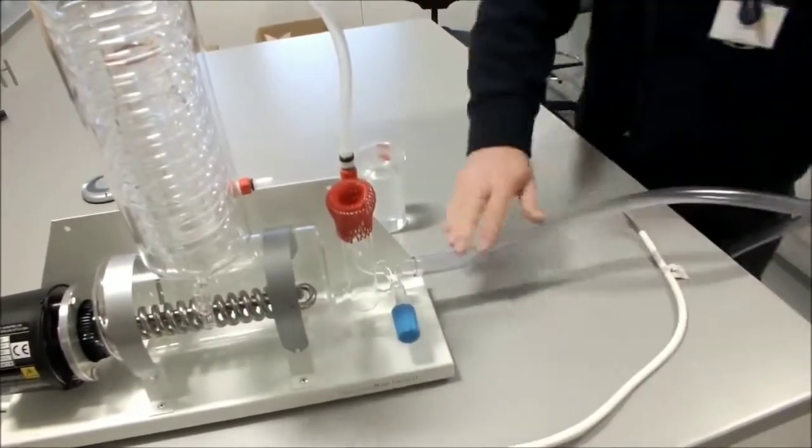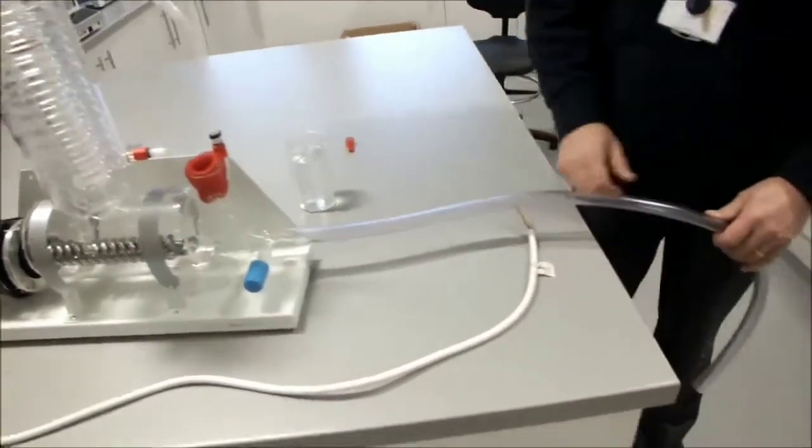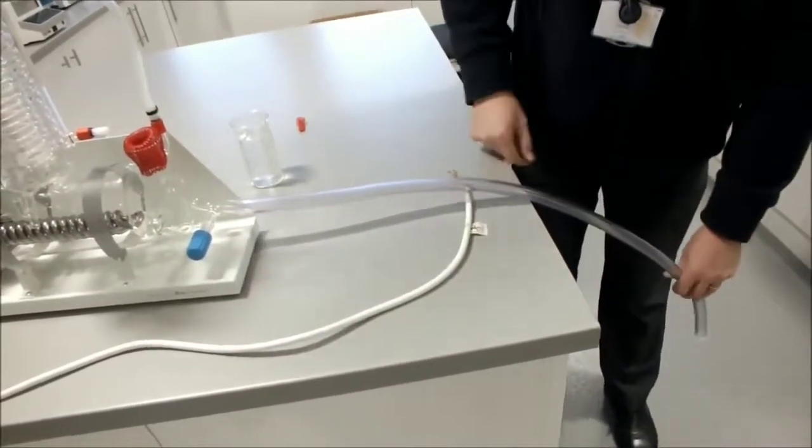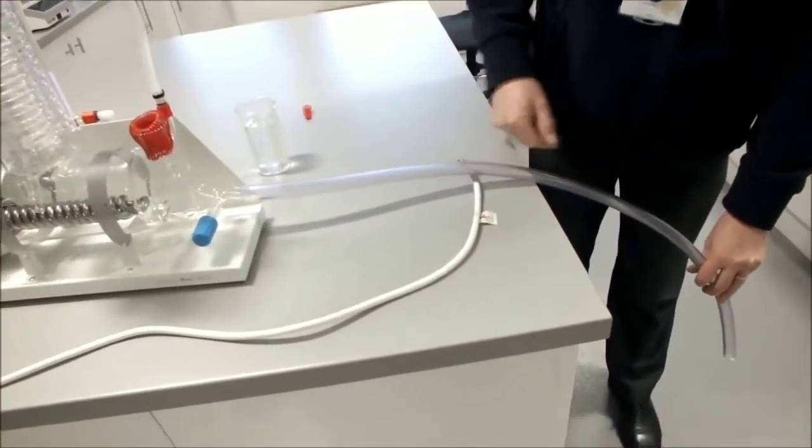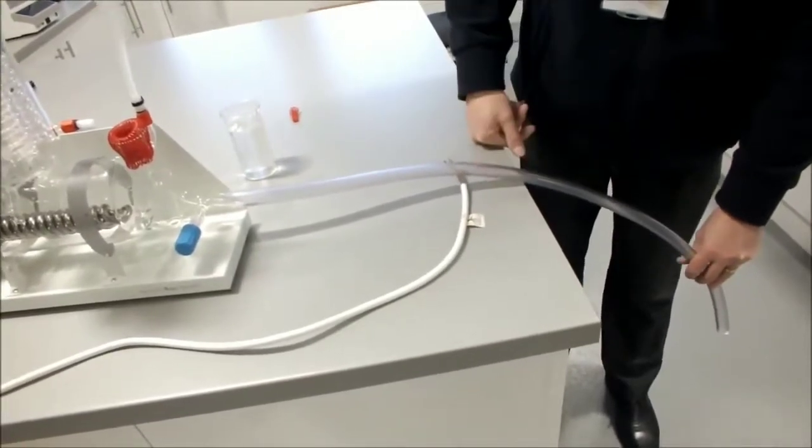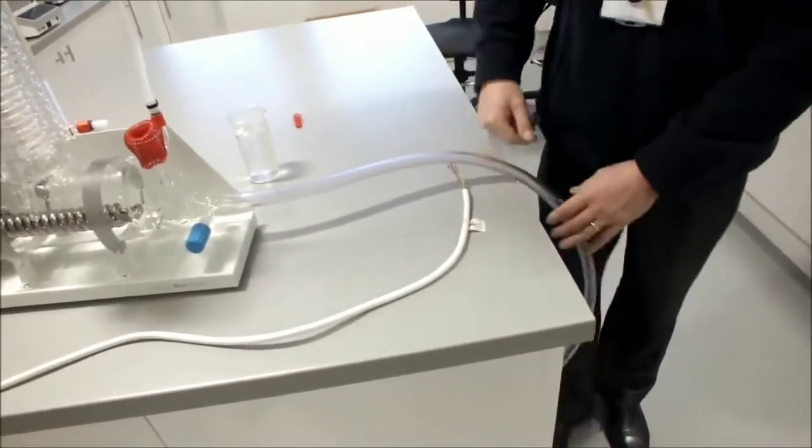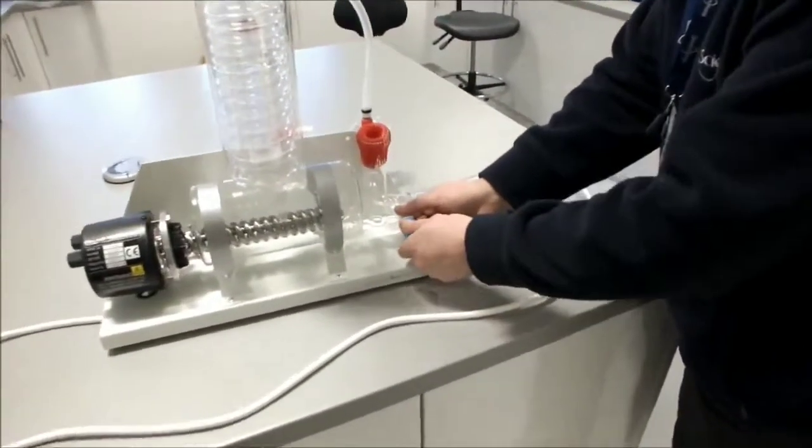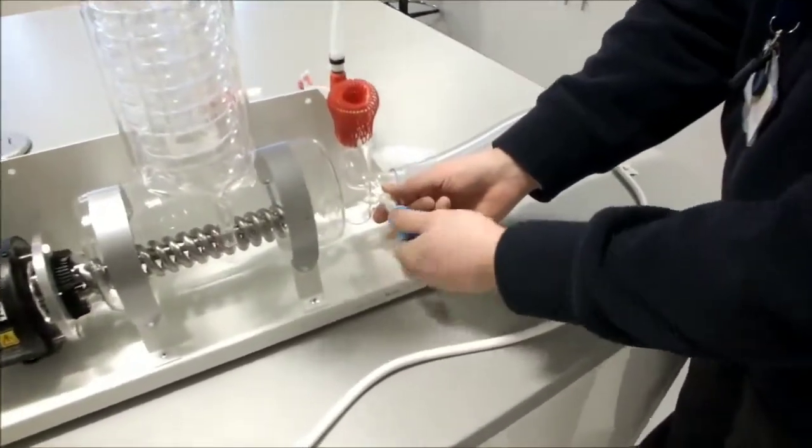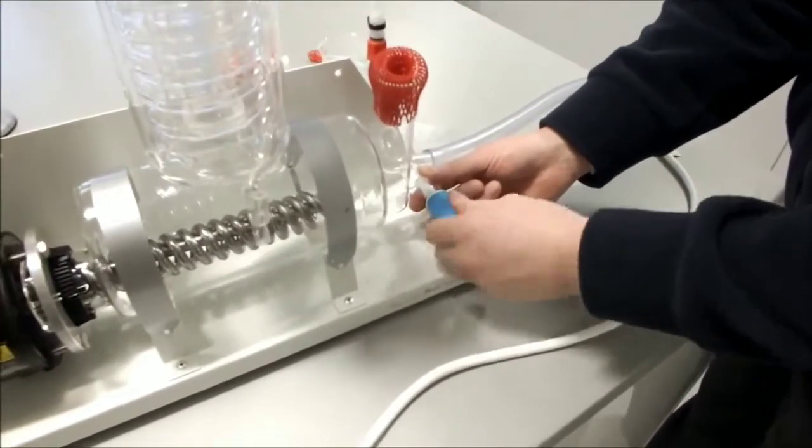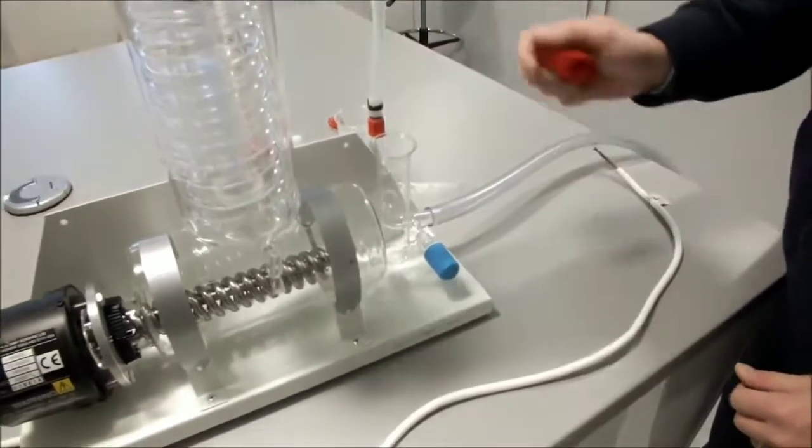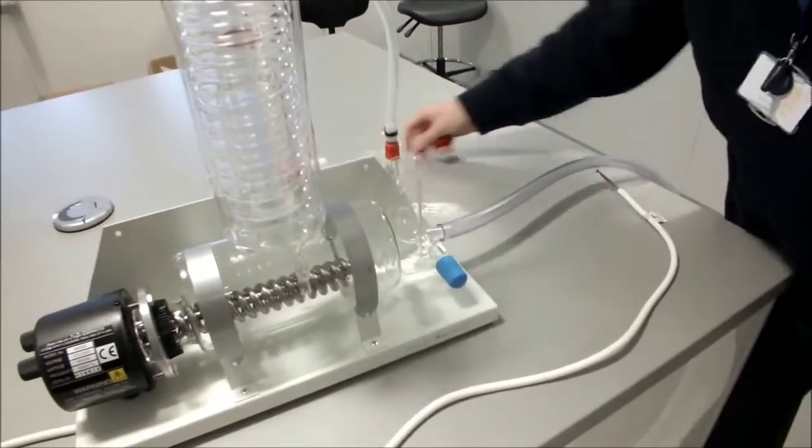The drain, when it leads away from the water still, you should ensure that it moves smoothly down away from the water still with no kinks because you will create problems if you have kinks in the drain. When you've done that, ensure that your stopcock is fully closed. And remove any covers, especially the one from the funnel that you may have left.